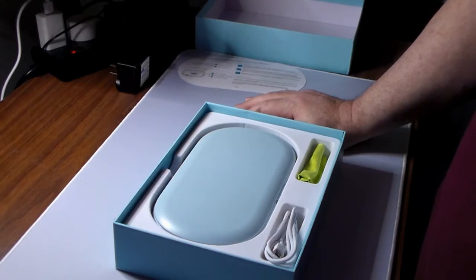And what I'm going to do is, I'm going to take the things it says that it can sterilize, and I'm going to get some petri dishes, and I'm going to build an incubator, and I'm going to test this. I'm going to test it on my phone, my keys, a sock. What else? Anything else that it says it can do, anything that will fit in here properly, I'll run a test on.